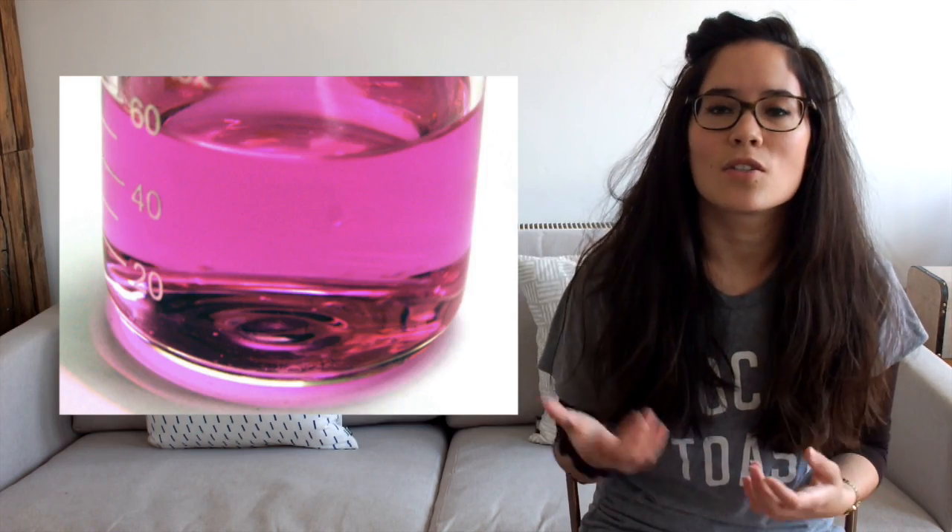The white tile is going to help you see the colour change which is about to take place. In order to see the colour change, we're going to need an indicator — an indicator is just like a dye; it changes colour based on the pH, the acidity or alkalinity of the substance. So you're going to add an indicator to the conical flask. We could use phenolphthalein — remember, this is colourless in acidic solutions and goes a stunning pink colour when the solution becomes alkaline.